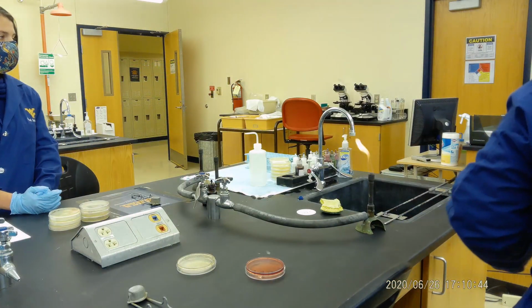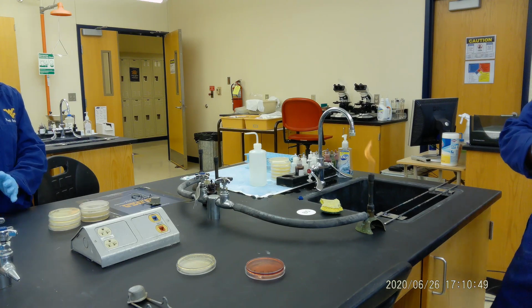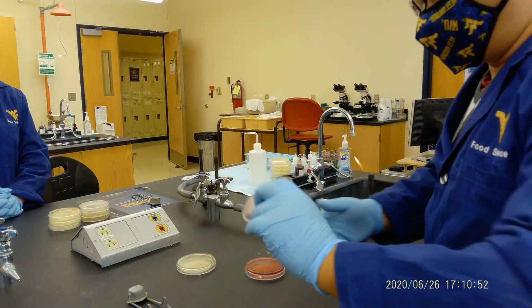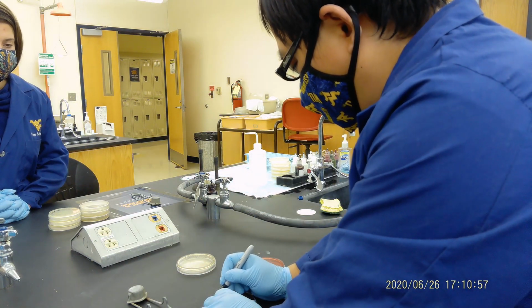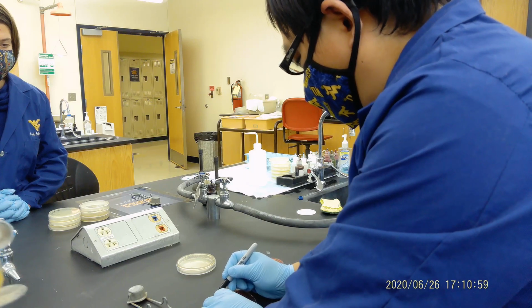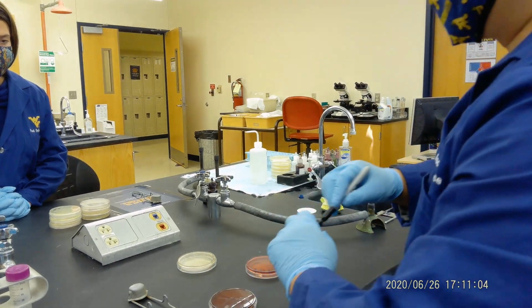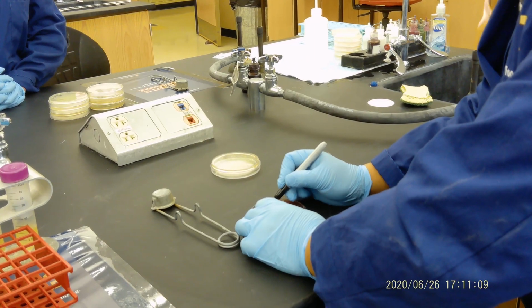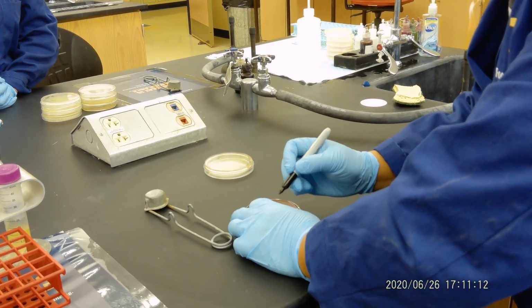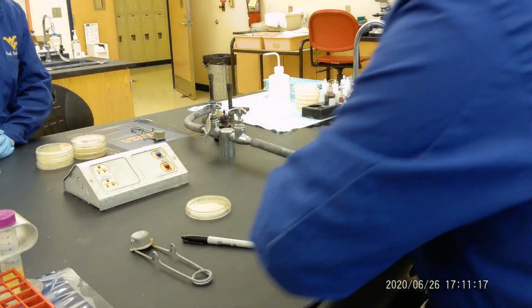Now the second one I want to show you is blood agar. So blood agar is like this. You will see at the back there's a blood agar. So what you do, of course, you're going to label. Okay, EC, S, number 1. We want to label it into 3 parts. Okay, we're going to label SA, Staphylococcus aureus, SAL, and EC. So label like that.